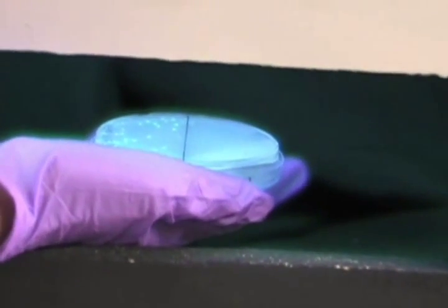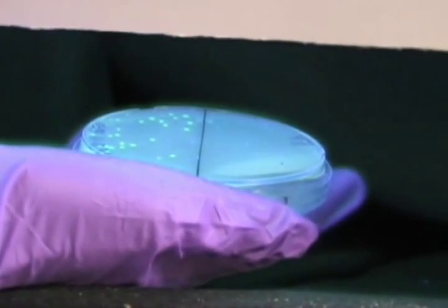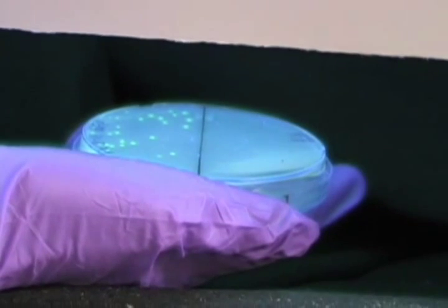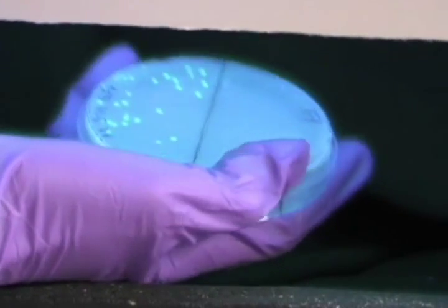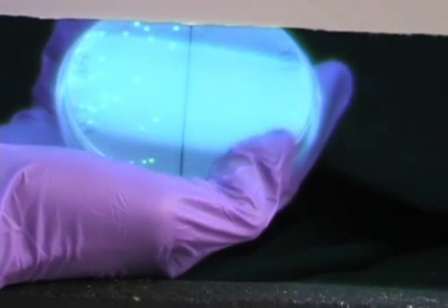Tomorrow, we will use a long-wave UV light to visualize the transformed cells. Hopefully, you will see bacteria that fluoresces green and blue and yellow.